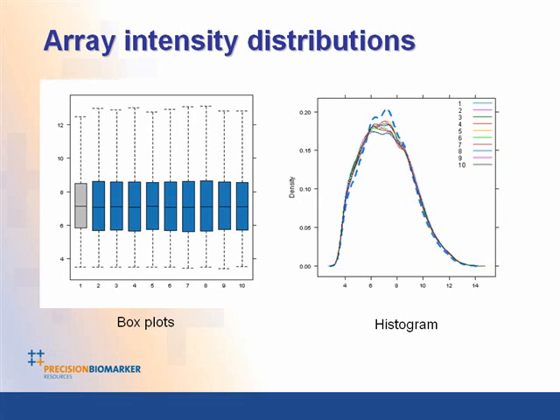see that the distribution of fluorescence intensities is a little narrower in number 1, so providing a little higher peak. On the histogram, it's denoted by the dashed line as opposed to a solid line, and on the box plot, it's in gray. The rest of the chips normalized very well with RMA.